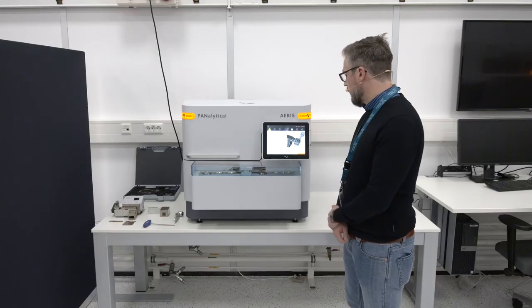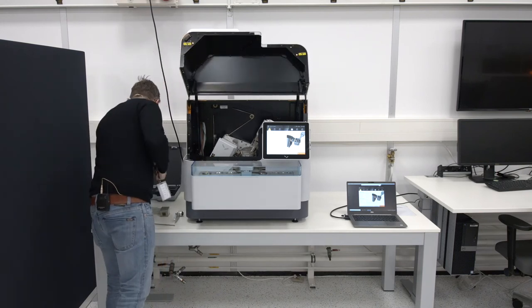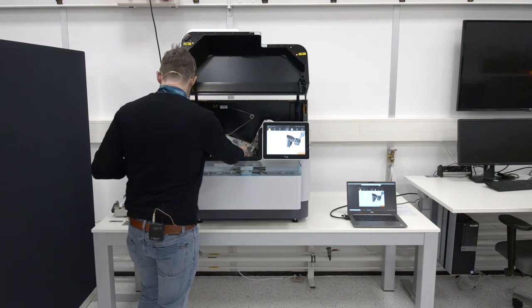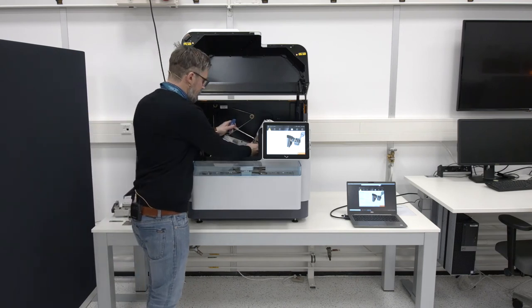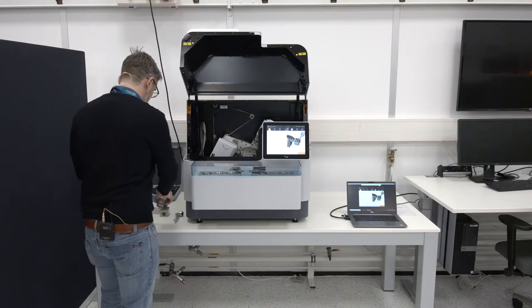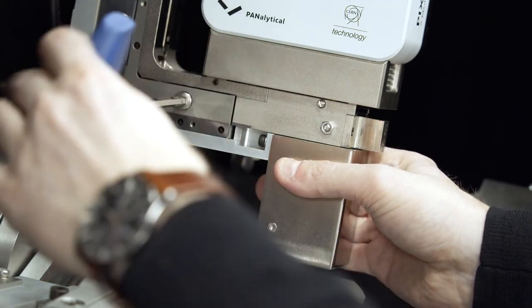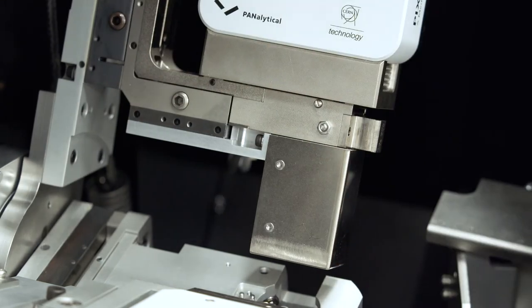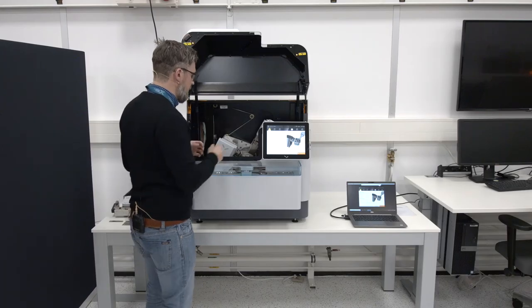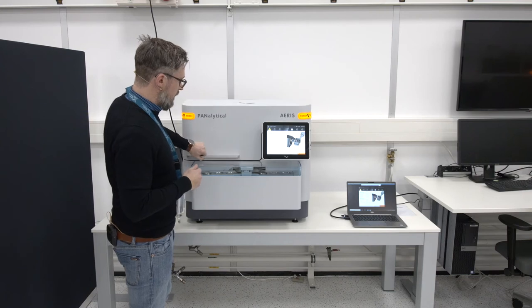To change the setup, you simply unlock the cover, which allows you to access the optical components and set the instrument accordingly. I am taking out the fixed anti-scatter slit and inserting the parallel plate collimator. I then use the 3 Nm key to apply a reproducible force to the prefix screws. I also take out the Soller slit in order to increase the counting statistics. Once done, I close the instrument.